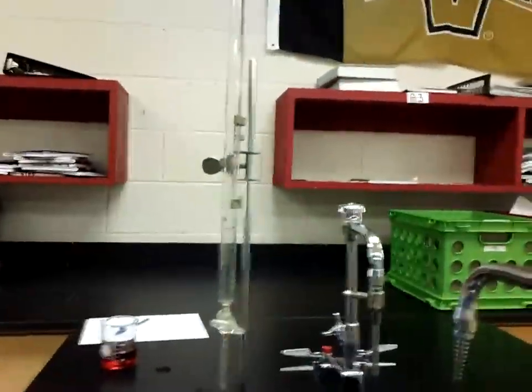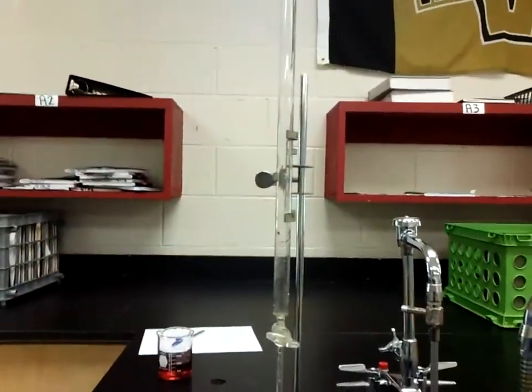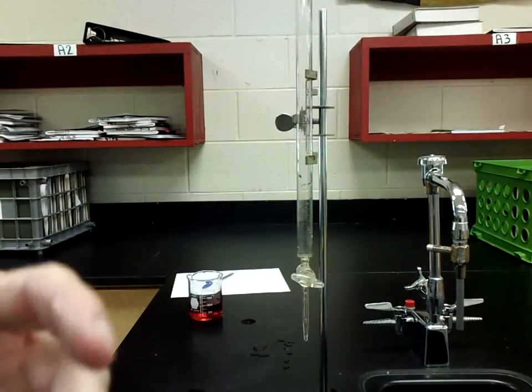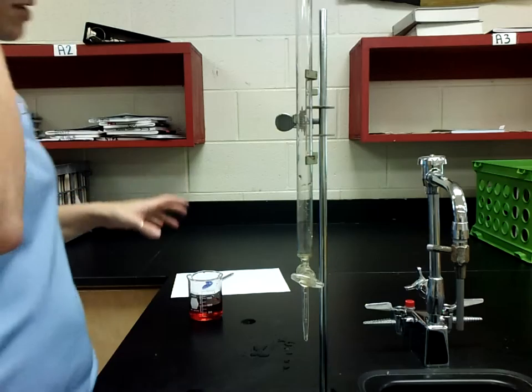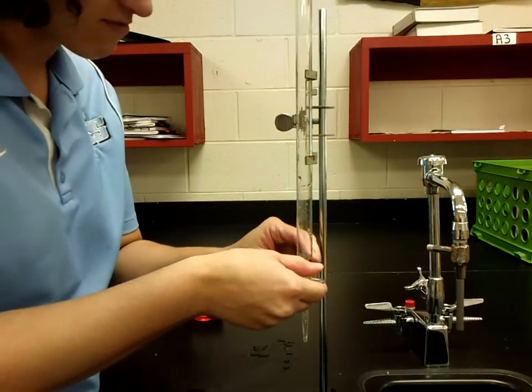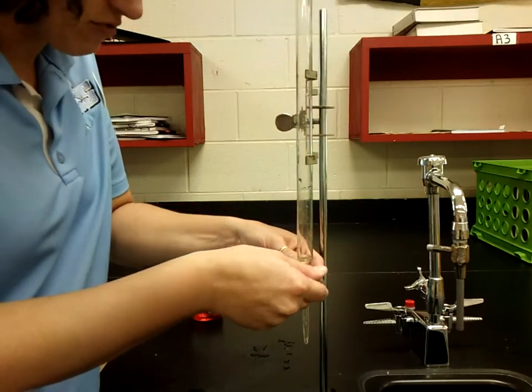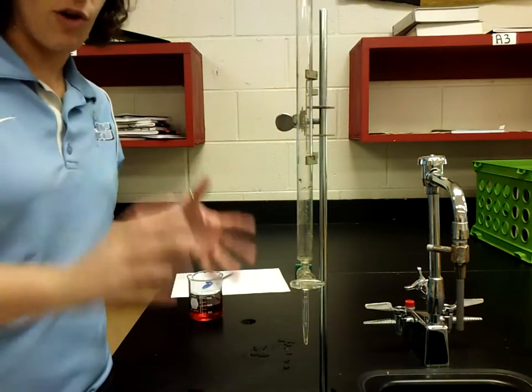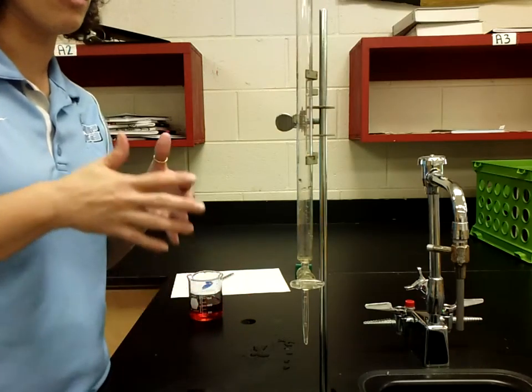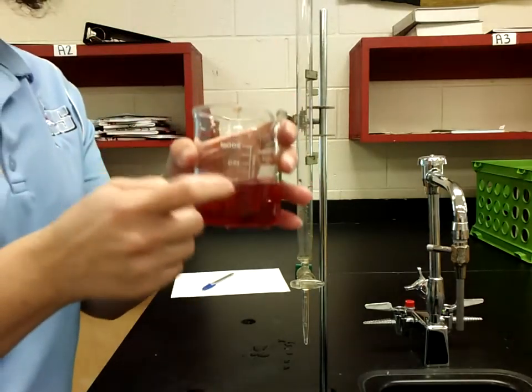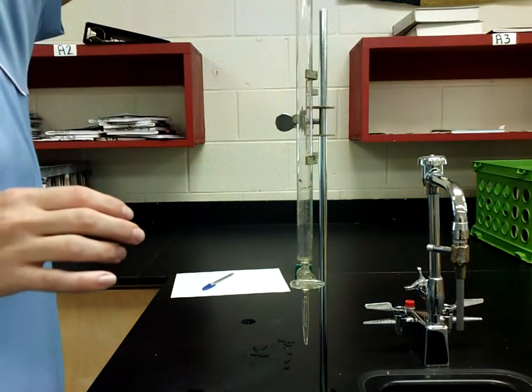The other thing that's going to be really important is you need to rinse your burettes at least twice with whatever substance you're using. This is to make sure that anything in the burette that is not what we want in our experiment has been washed clean. If you don't do this, what you're going to end up with is you're going to end up with other crap in your burettes which are going to lead you to have different volumes than what you should have in your lab.